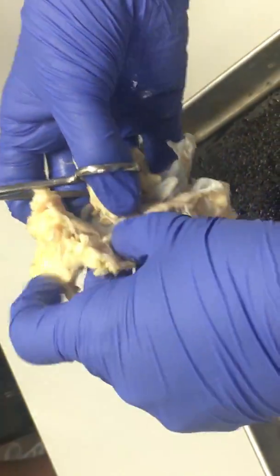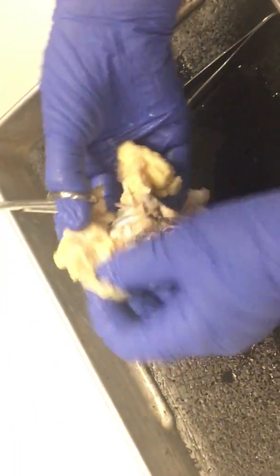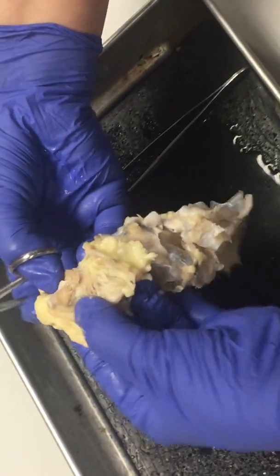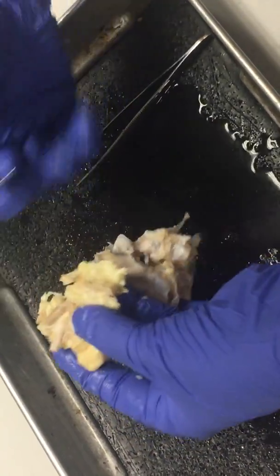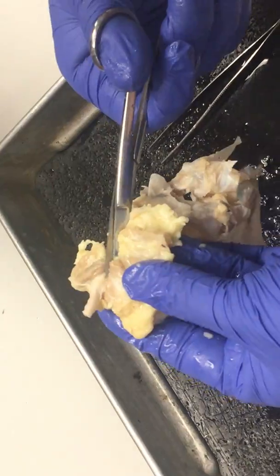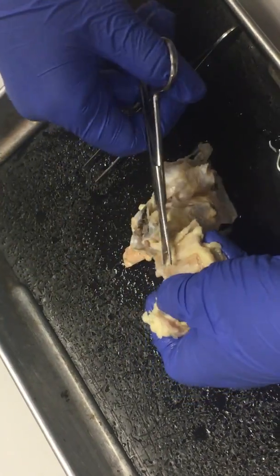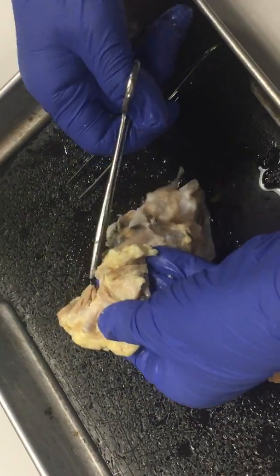So, I guess we could try to figure out which one it was — I'm completely disoriented here. But we do have another eye muscle right there. Yours are going to be a little less distinct when we do the eyes because you're going to have cow eyes, and they were just cut out when the cow was butchered, so they're not cut out very nicely. Here's our optic nerve — you can see it's a really tough, thick structure.